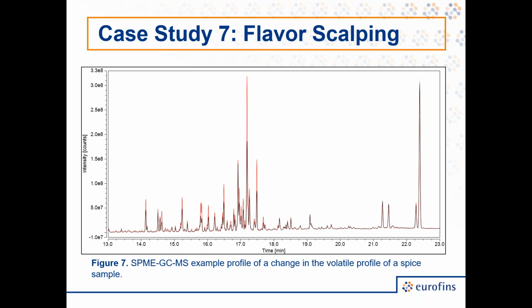So what we have here is a theoretical example of what flavor scalping could look like. In red, we have a profile of a spice, and then in black, we have a profile of what that spice might look like under circumstances where it was in packaging that was then scalping different compounds.